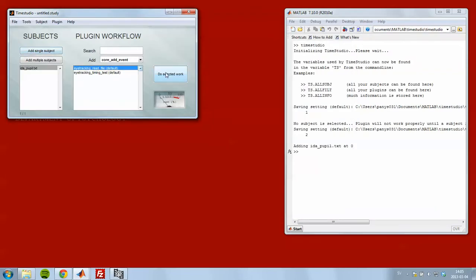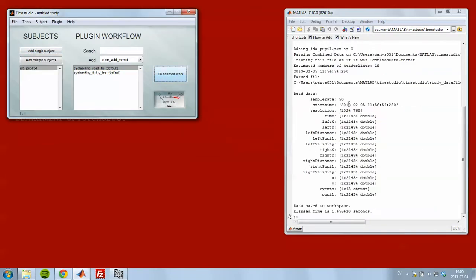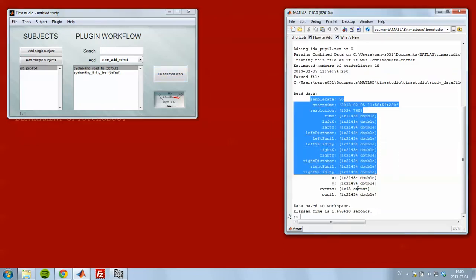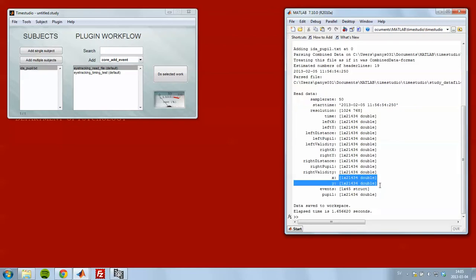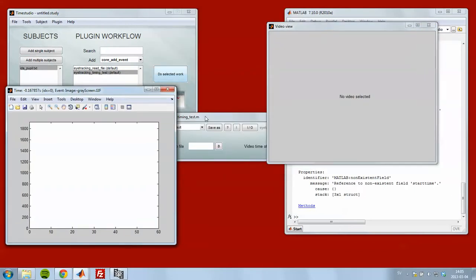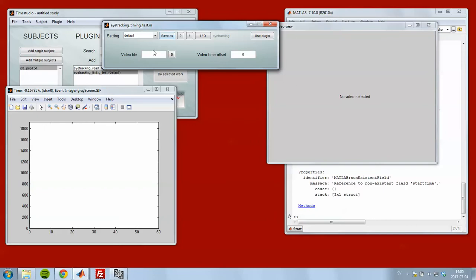I open it and I can read it, and I see that I get lots of data about it. See that we have some X and Y coordinates, that's good, and we have some events, 45. And I want to know if these events are properly time locked to the stimuli that I presented on another computer. To check that, I double click the eye tracking timing test plugin to bring up this window.